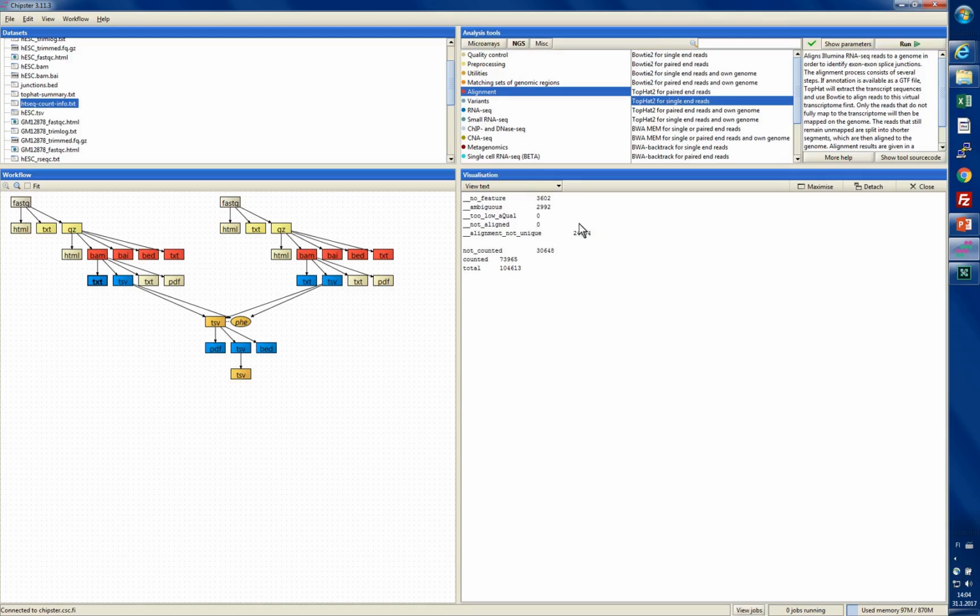And up here you can see explanations for why they were not counted. This is a summary of some of these rows up here. For example, 24,000 were not aligned uniquely, and roughly 3,000 were ambiguously aligned, meaning that there were two genes on different strands at that position. So the software couldn't decide which gene it is counted to, and 3,600 alignments were not in any gene area. They were in the no feature area.